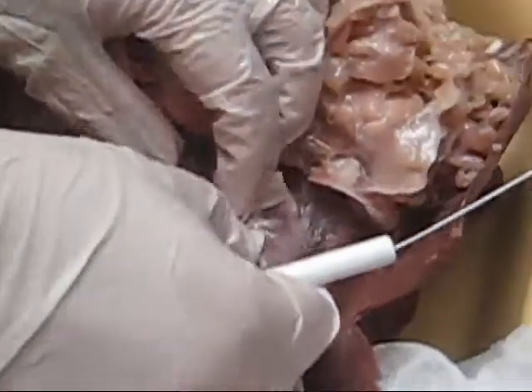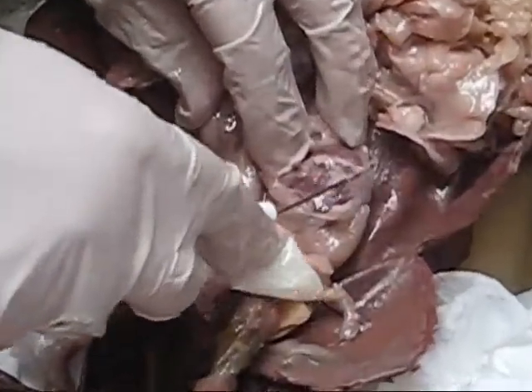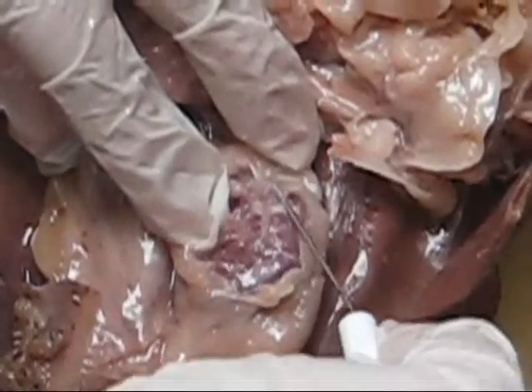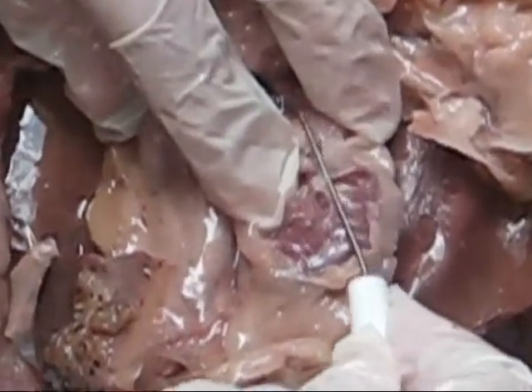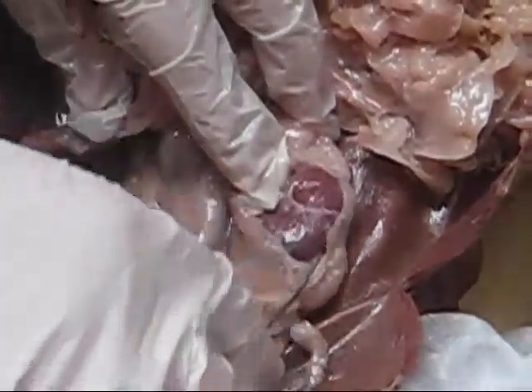Let me clean this up. This is the kidney itself — kidney number one. The covering on the kidney — that is the renal capsule. This is the renal capsule right there. So it's the fascia, the fat, and then the renal capsule. It looks like those kidney beans.